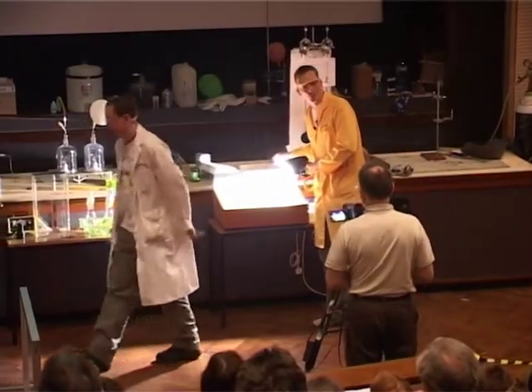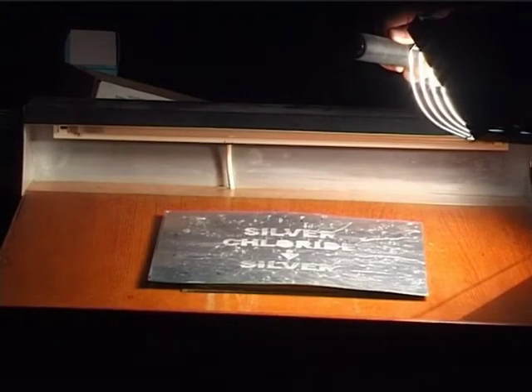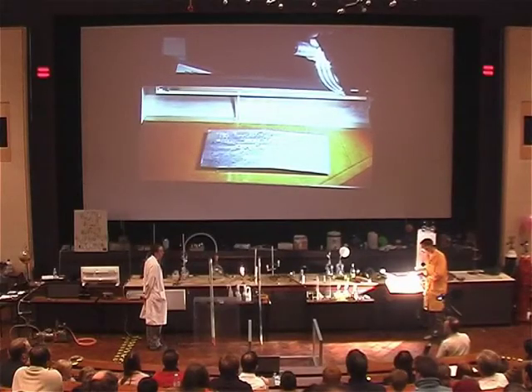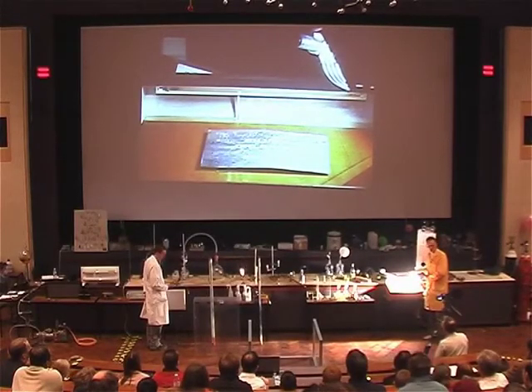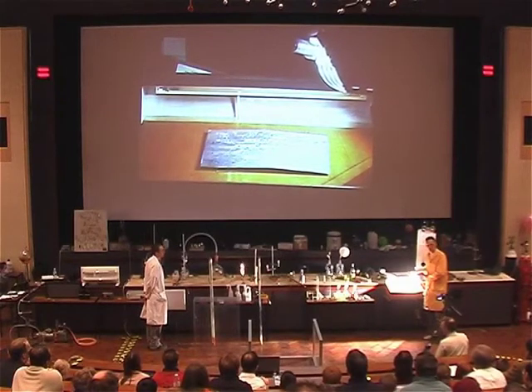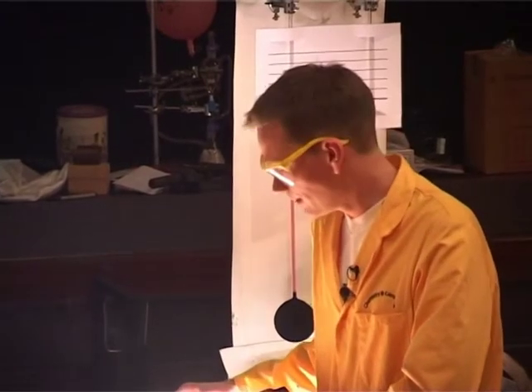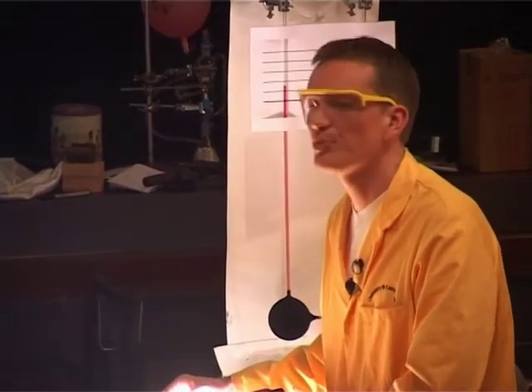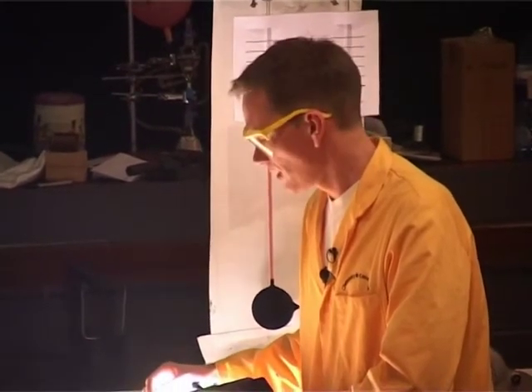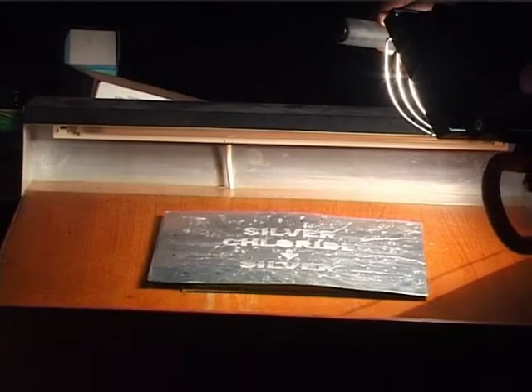So, we have the white silver chloride. We're shining the light onto this now, and the light is causing a chemical reaction. The light breaks down the silver chloride and forms some silver particles. Now, these are a very different colour from the silver chloride. The silver chloride is white. Silver is a metal, and it's slightly metallic coloured. We should be able to see some of the silver being formed in this reaction. So, we just need to give it a decent amount of time in order for it to react.